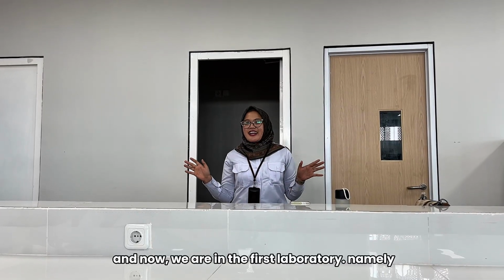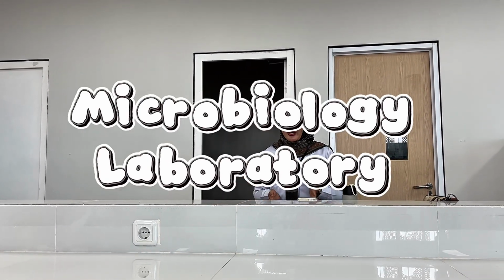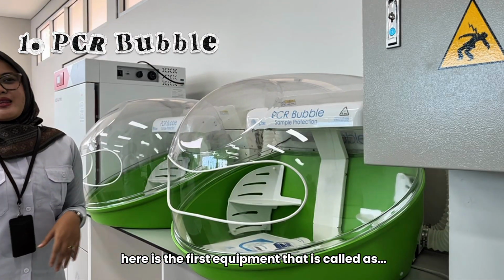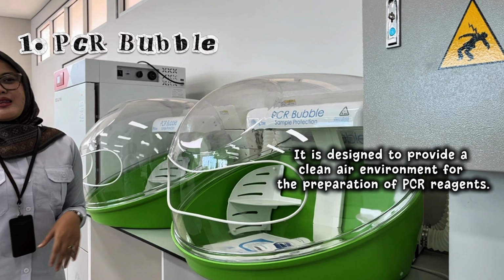Now we are in the first laboratory, namely the microbiology laboratory. Here is the first equipment, called the PCR bubble. It is designed to provide a clean air environment for the preparation of PCR reagent.